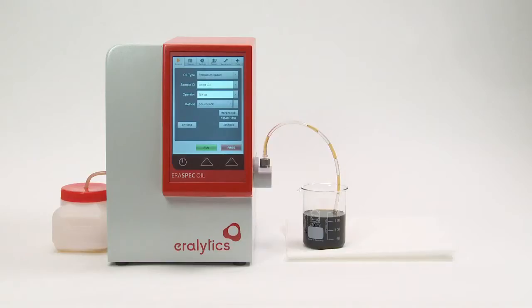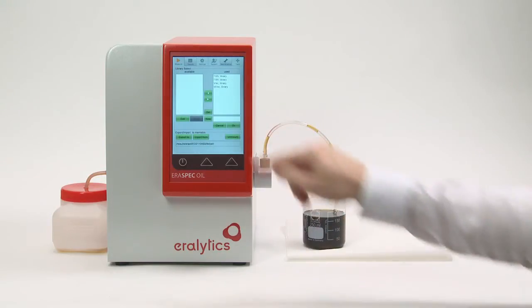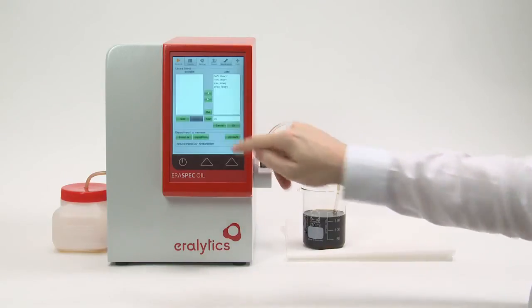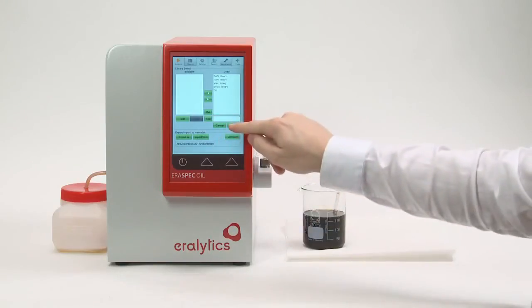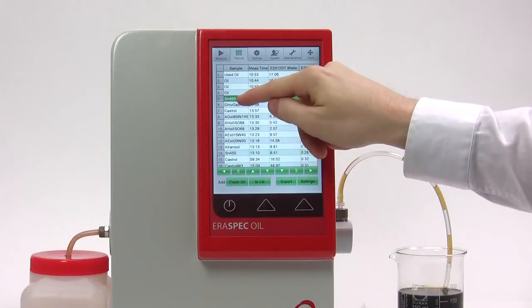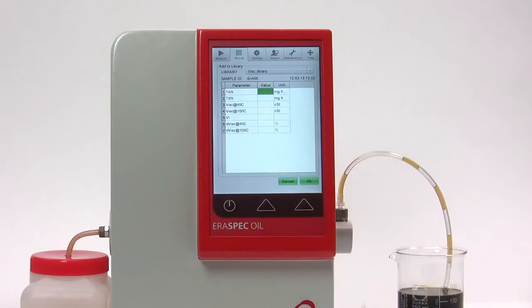To create a new library, click Libraries in the Measure menu. Enter the name of the new library and press the button New. To add a spectrum to the library, click on the Results tab. Mark the spectrum where the complex parameters have been obtained by the corresponding reference methods and click Add to Lib.